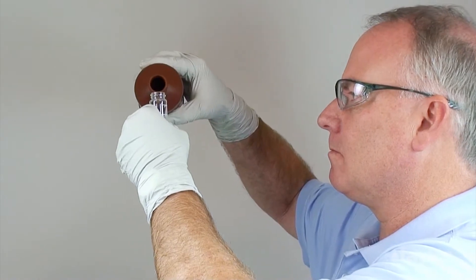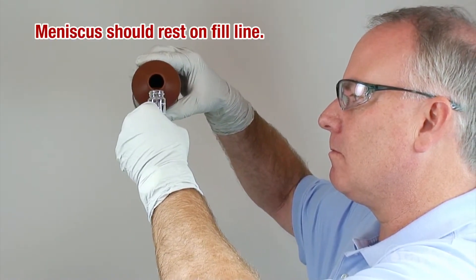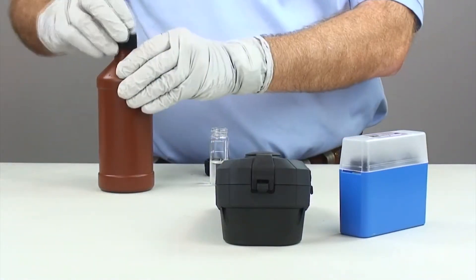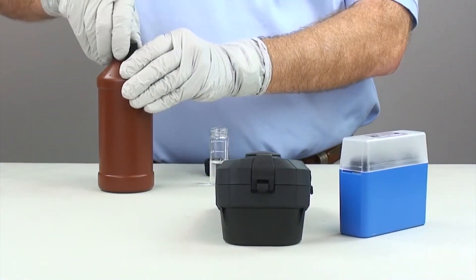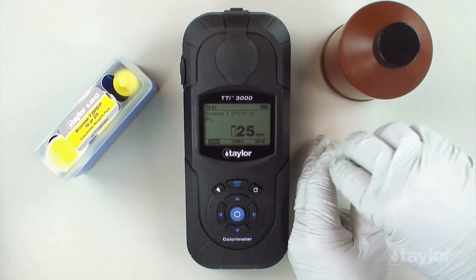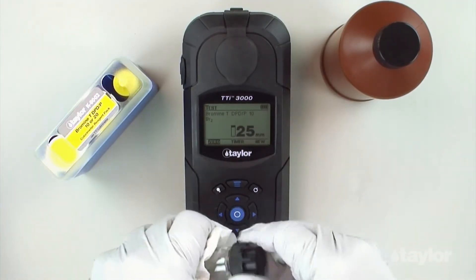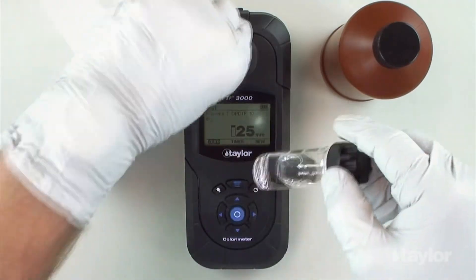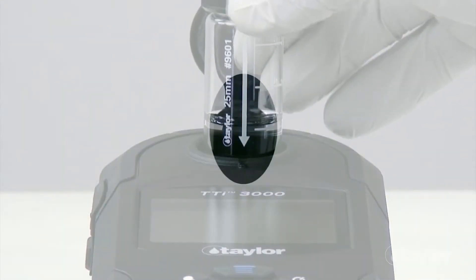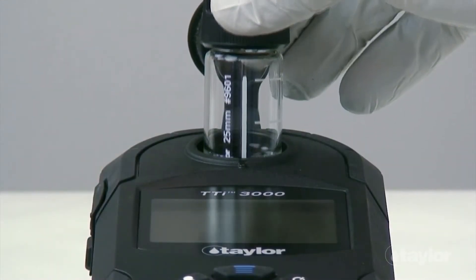Rinse and fill the 25 millimeter sample cell to the 10 ml mark with the sample. Then cap. Insert the sample cell into the sample cell compartment, aligning the arrow on the cell with the notch on the sample cell compartment, then gently push down.